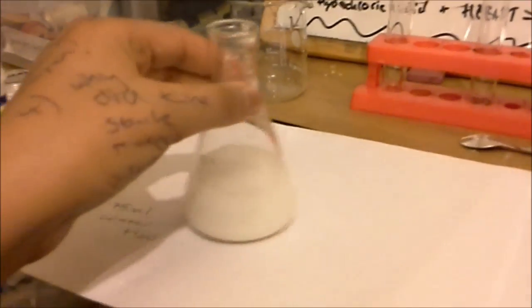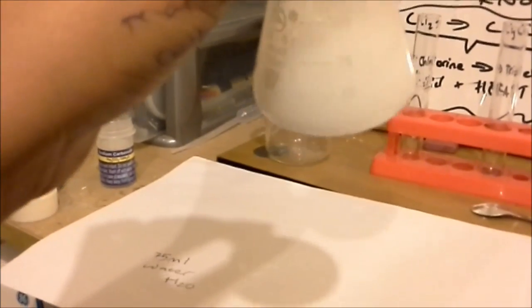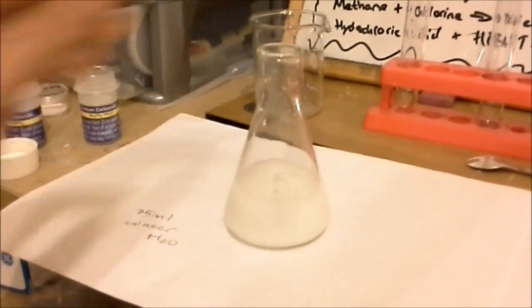So as you can see I've mixed it and it's become a very cloudy mixture. Now what we're going to do is filter it.